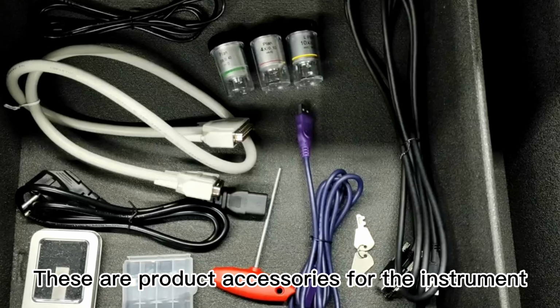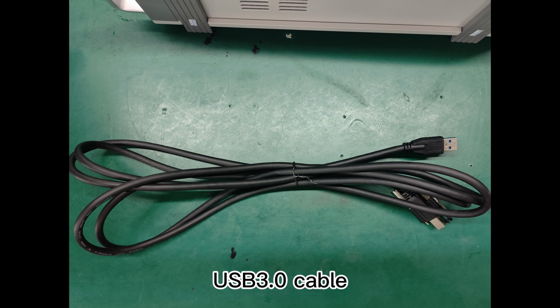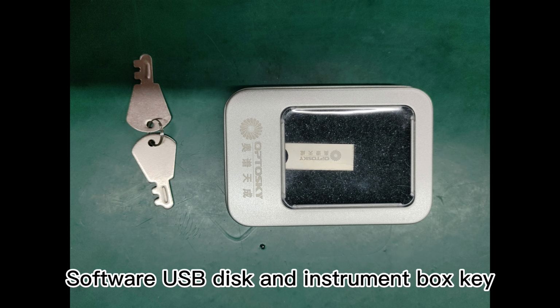These are product accessories for the instrument. They are hexagonal screwdriver, USB cable, visible light data cable, USB 3.0 cable, power cord, objective lens, test sample, DB25 cable, software USB disk, and instrument box key.